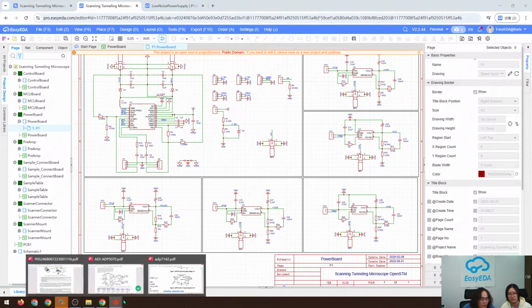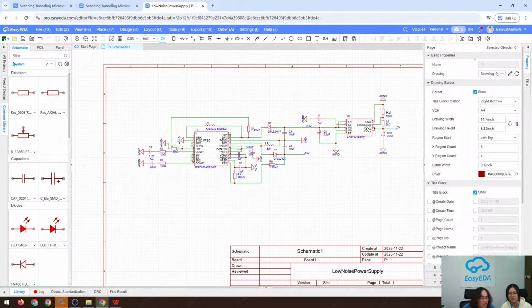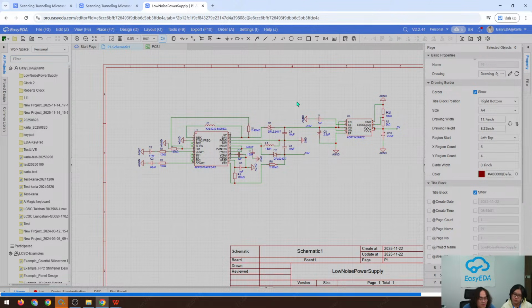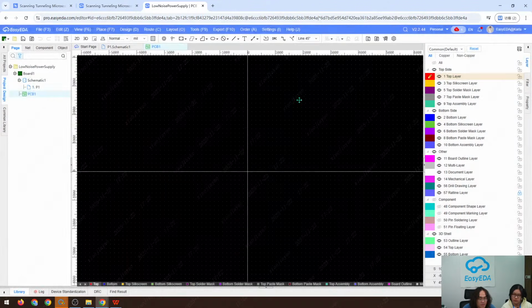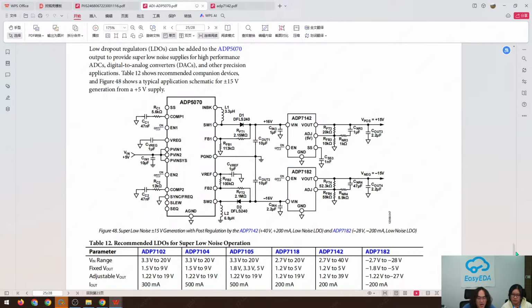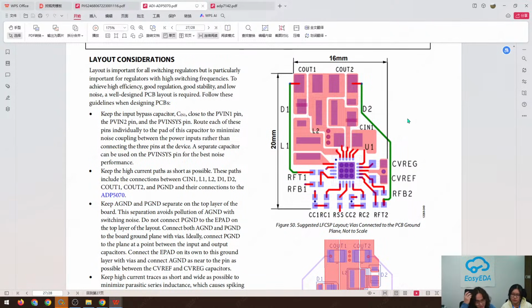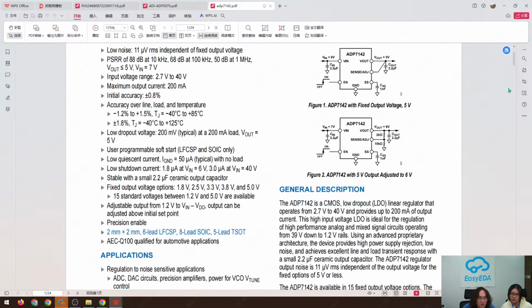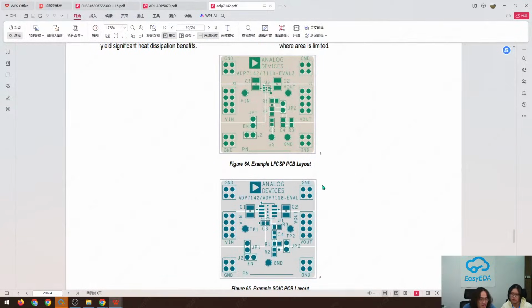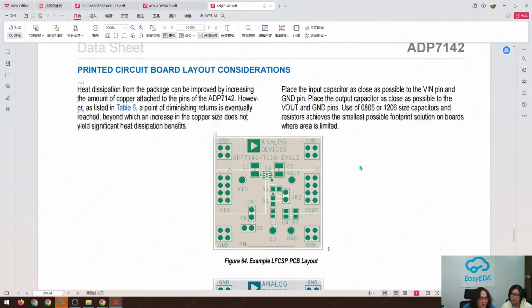And if you want to design your own one, since we have already finished the schematic, we can convert it to the PCB. Once you've converted to PCB, you can refer to the ADP5070 datasheet for its layout, and there's a very detailed layout here, and the LDO's datasheet layout, and all the layout you can find in the datasheet, and you can refer to how the ground plane goes and so on from here.